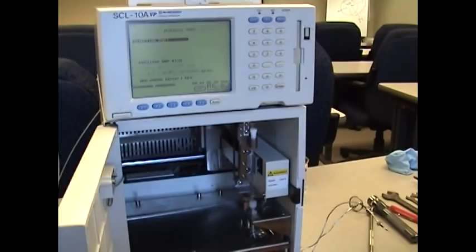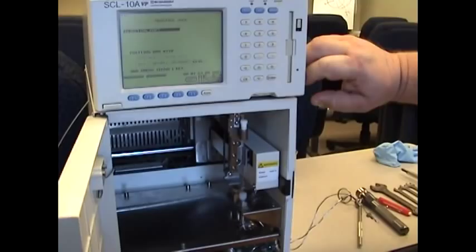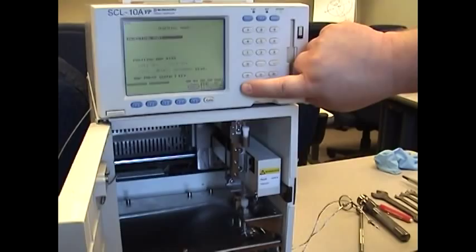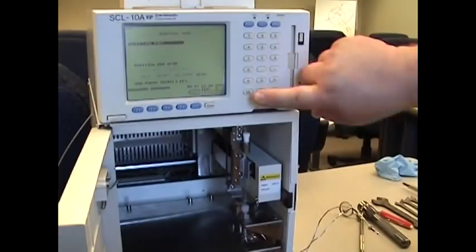You can start by moving the needle down by hitting the CE key. Initially, it will take a large step. And then from there, keep hitting CE. It will take individual steps. If you want to accelerate this, you can hit F5, which is shown by shift. And that will take multiple steps at once.